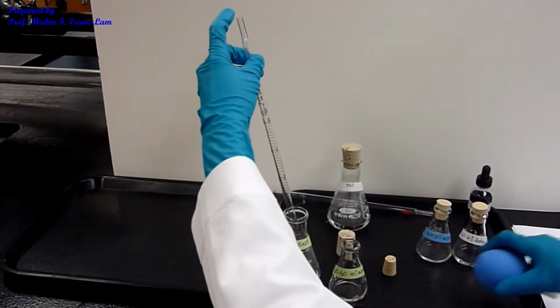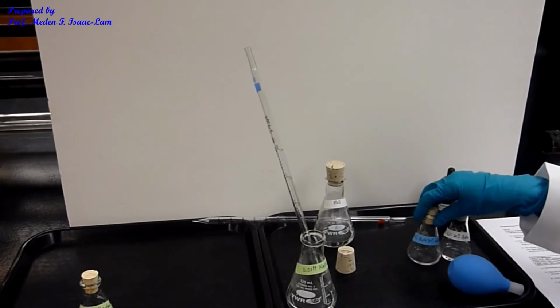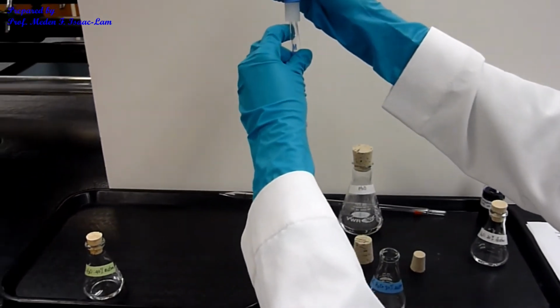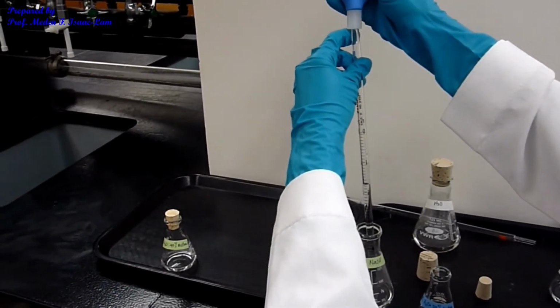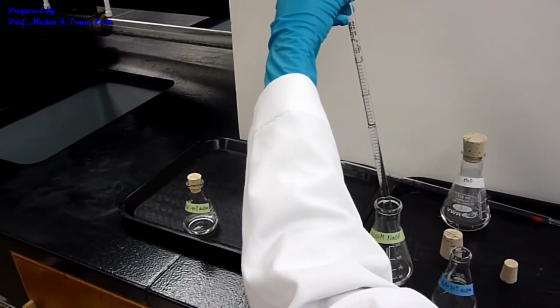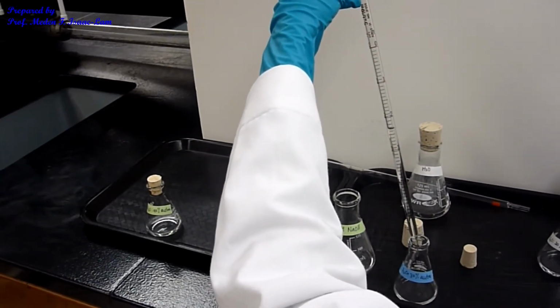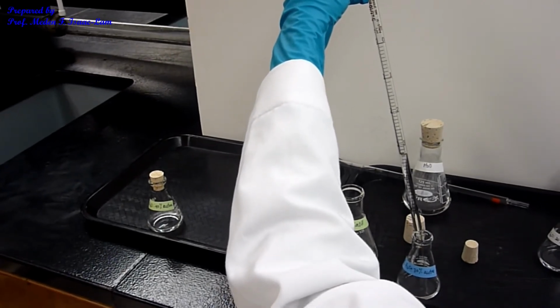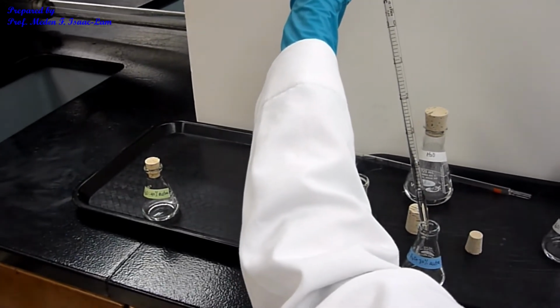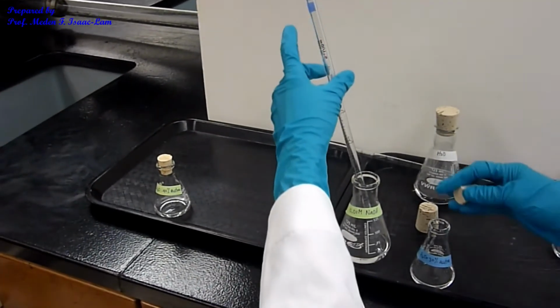Okay, so now I cork it. It's the first sample. The second one, I need 3 ml. So 3 ml, I can also withdraw just up to 2, and then to 5, then I have 3 ml. So I'm going to deliver until 5 ml, because I need 3. Okay, so that's the second sample.